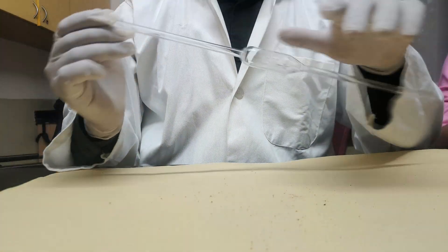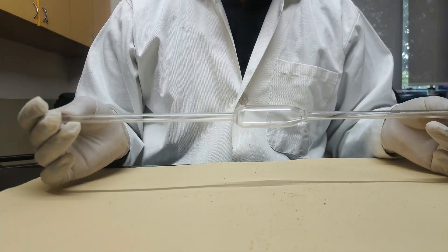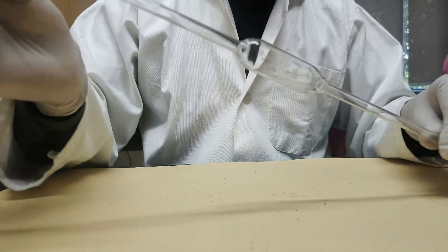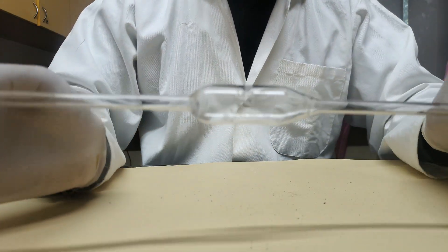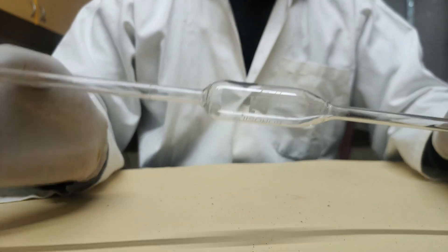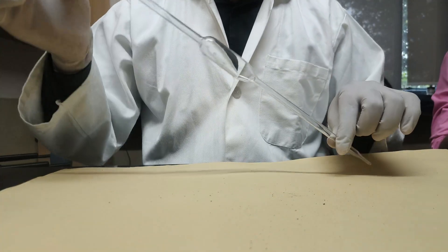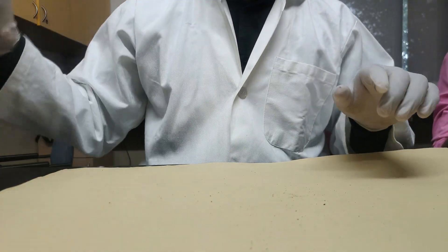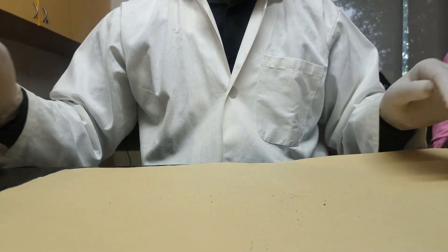Next is the pipette. It is used in volumetric work to measure 25 ml — as you can see the marks clearly. It has a 25 ml capacity and also comes in different capacities like 10 ml and 20 ml.